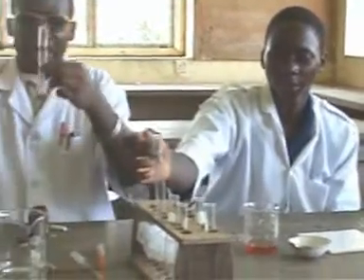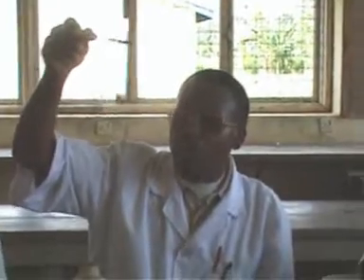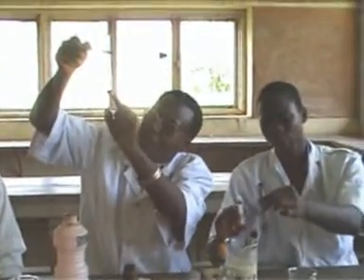So you do it. Then, in my own case, when I added the Sudan 3 solution, I observed a brown coloration, and there is also a distinctly red precipitate inside this solution. There are distinctly red precipitates which are sparingly distributed inside my result. So this automatically means that this food substance contains fat, but the fat too is not very much. There is some fat, but it is not very much. That's why I can observe these sparingly distributed red precipitates.